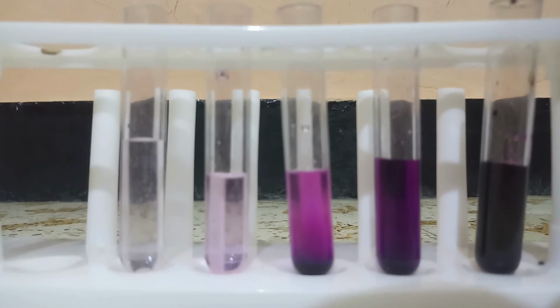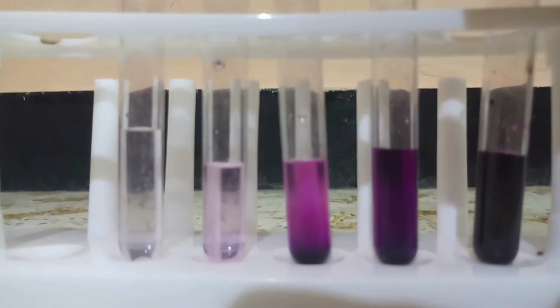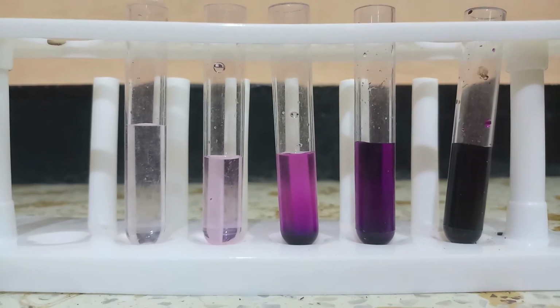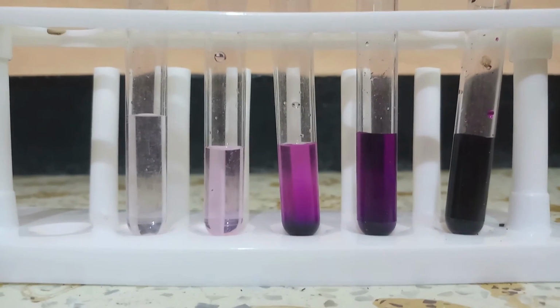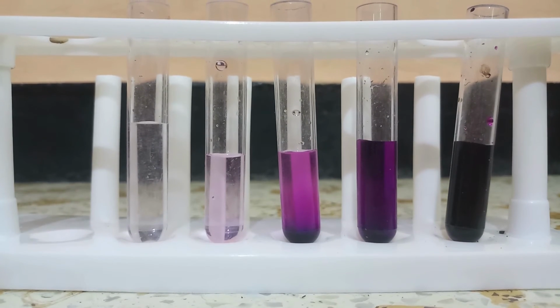As I said before, let's say we have 100 drops. When we take 10%, here we'll have 10 drops, and here we'll have 1 drop. Here we'll have only 0.1 drop. So from here to here we calculate: this is 100% color, this is 1% color. Observation is that the color from test tubes 1 to 5 is arranged from darker to lighter. When we add the potassium permanganate in the first tube, we'll get 100% color. Then when we take 10% of it, the second tube will have 10% color.